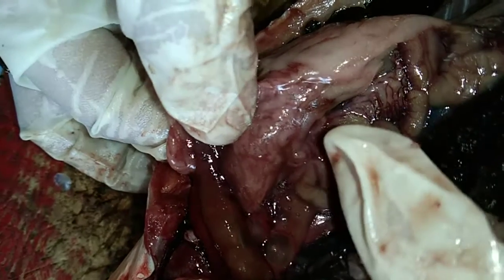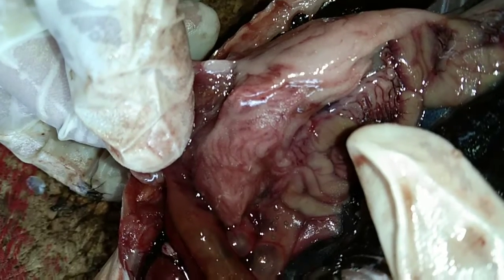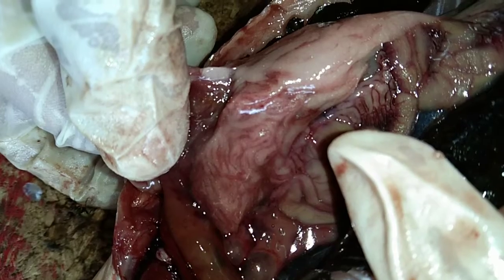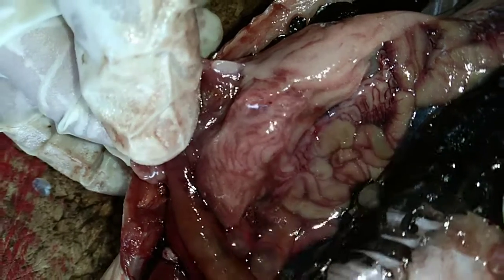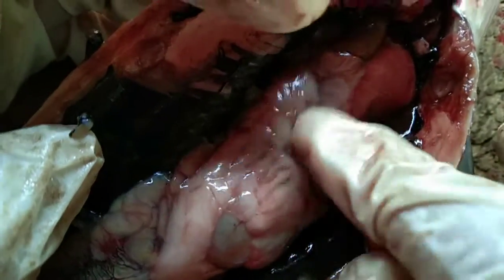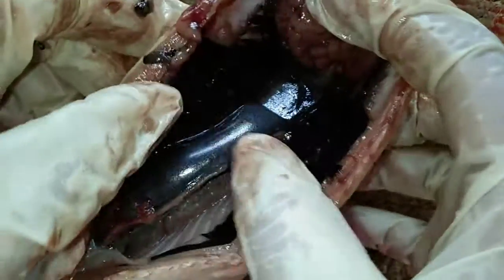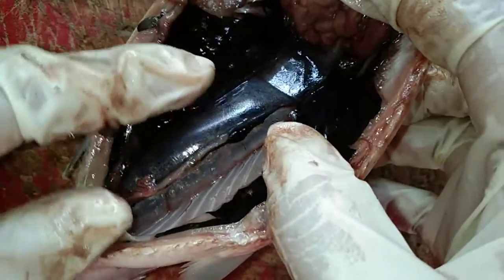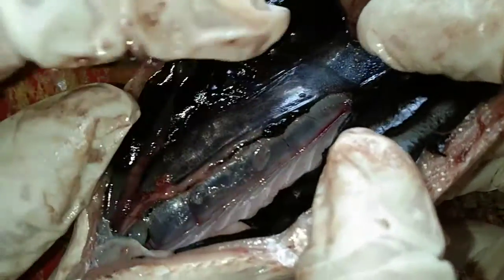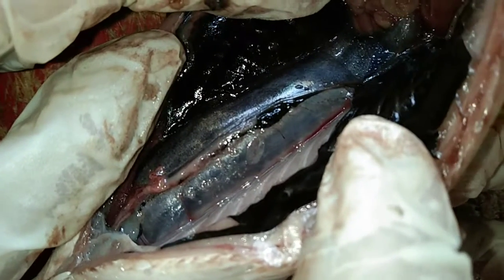This one is the pyloric caeca. It is known to secrete enzymes that aid in digestion, and may function to absorb digested food. This is the adipose tissue, which serves as the fat storage of the fish. This is the swim bladder. It allows a fish to conserve energy by maintaining neutral buoyancy in water.